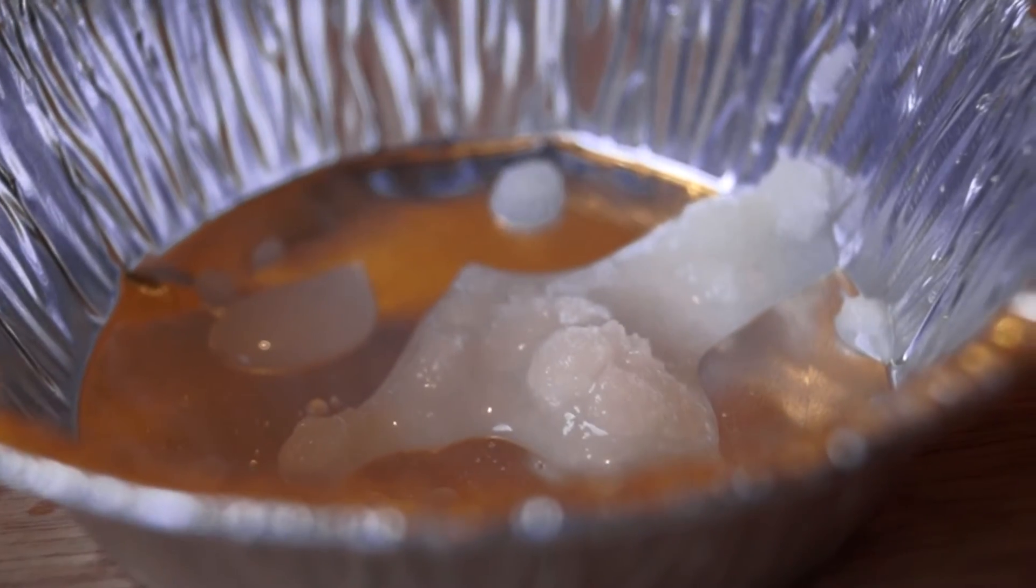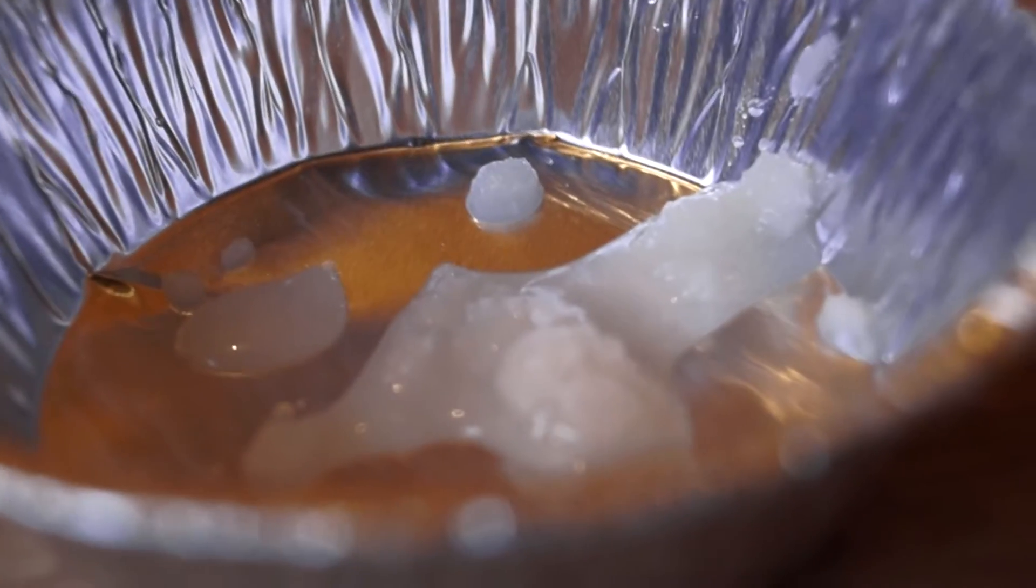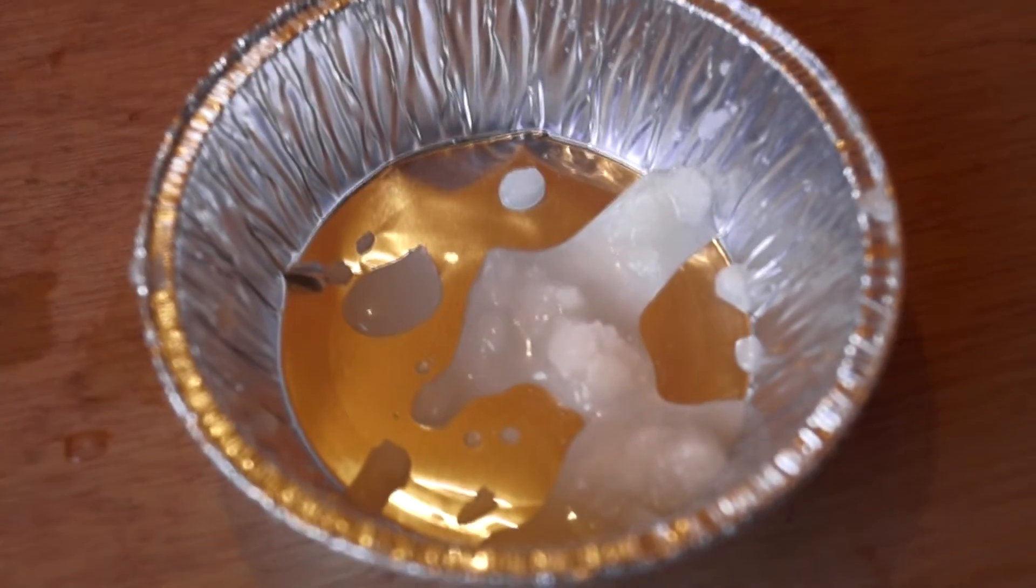This can then be heated or put in the oven to remove the waters of crystallization to form anhydrous sodium acetate.